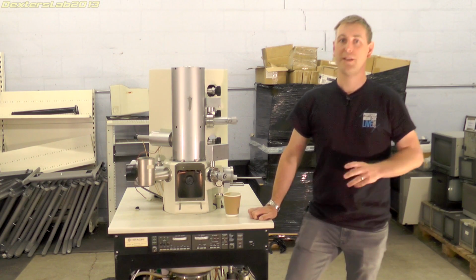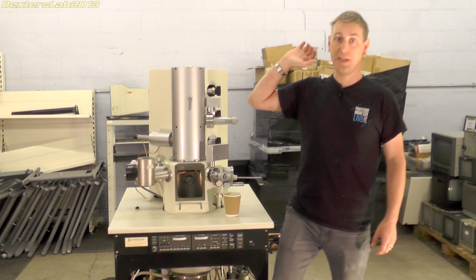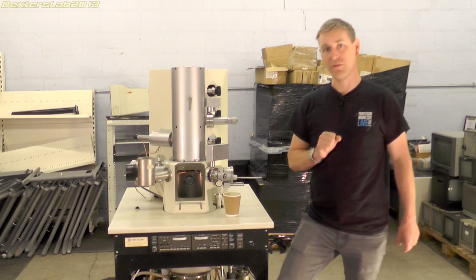I should point out that so far the two small ion pumps, the electron gun assembly, and the secondary electron detector have already been claimed and will be heading off to the new owners once they've been removed.